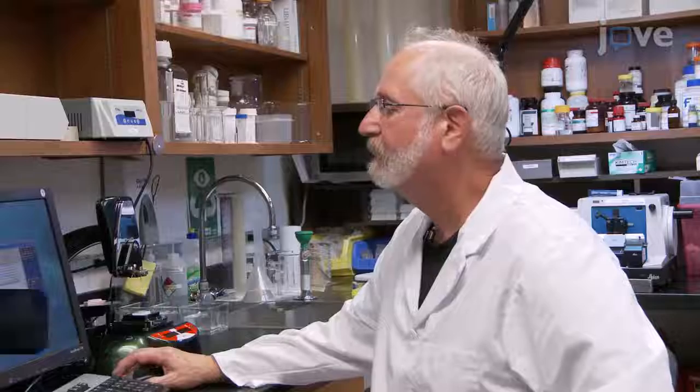This protocol is mainly about how to use protein quantification in immortalized cell lines to validate the quantitative nature of an immunofluorescence-based assay. But it's important to note that immunofluorescence can easily be incorporated into a multiplexed approach and applied to primary biopsy samples. Assisting in demonstrating this procedure will be Boudreau, a technician, and Shakeel Virk, the Director of Operations, both from the Queen's Laboratory for Molecular Pathology.